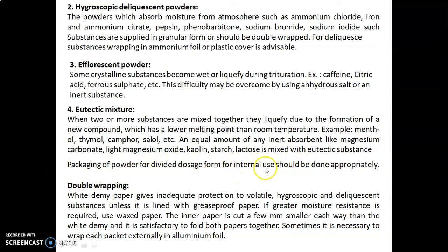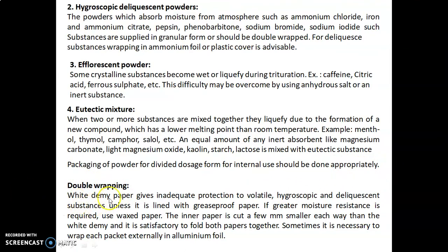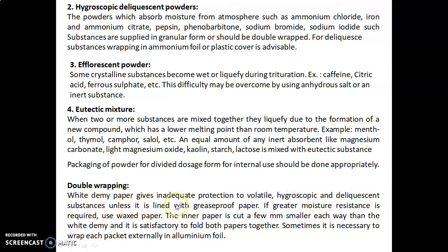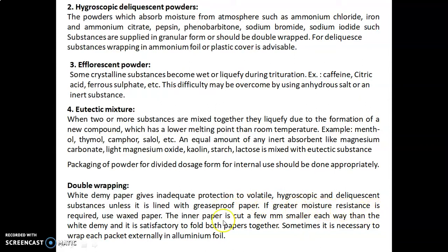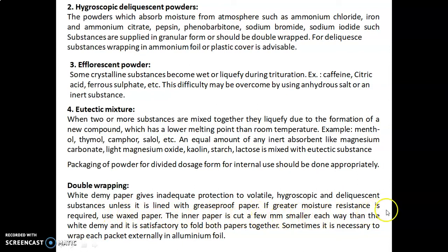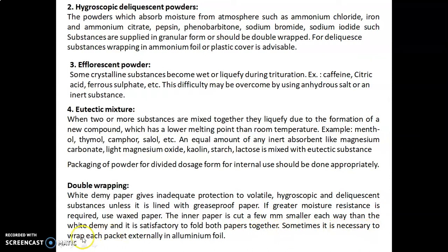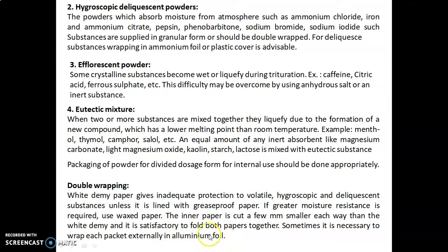Packaging of powder for divided dosage forms for internal use should be done appropriately. Double wrapping in white demi paper gives inadequate protection to volatile, hygroscopic, and deliquescent substances unless it is lined with grease-proof paper. If greater moisture resistance is required, use waxed paper. The inner paper is cut a few millimeters smaller each way than the white demi, and it is satisfactory to fold both papers together. Sometimes it is necessary to wrap each packet externally in aluminum foil.